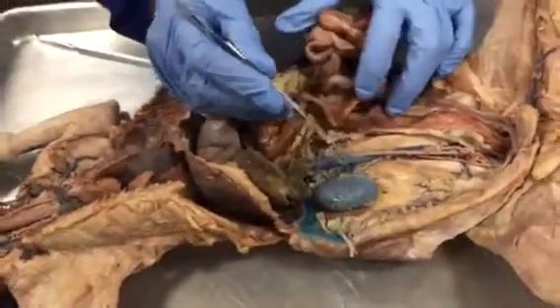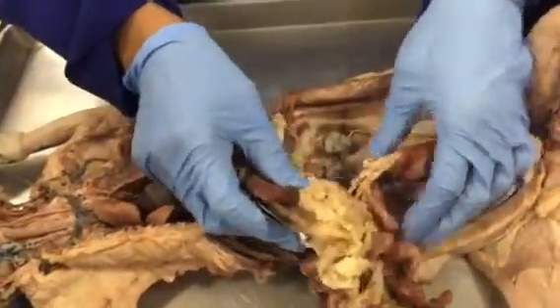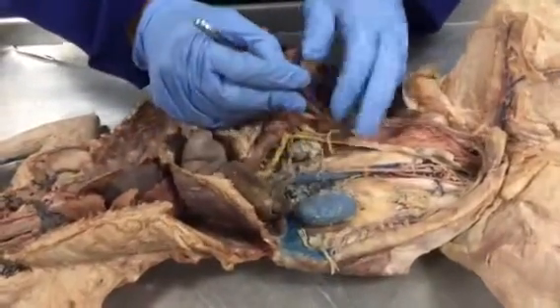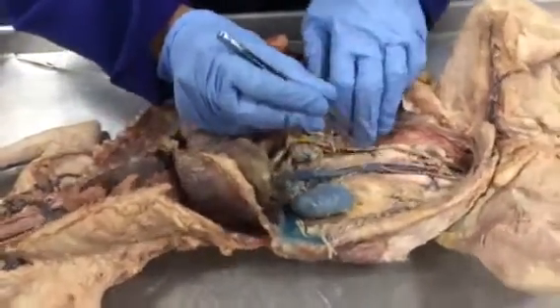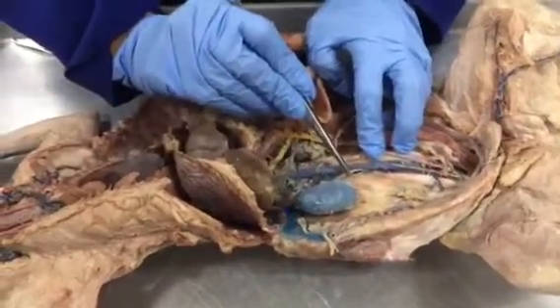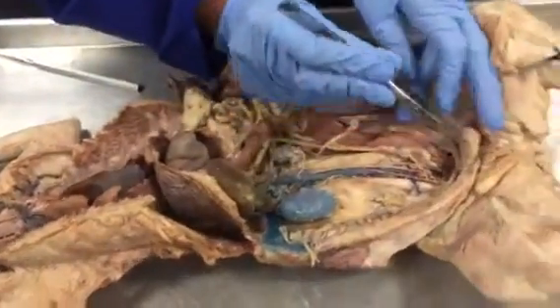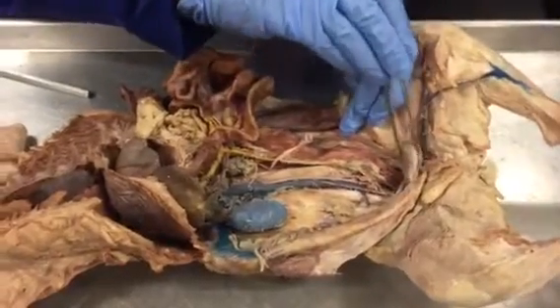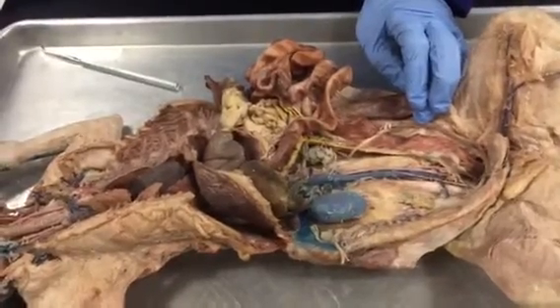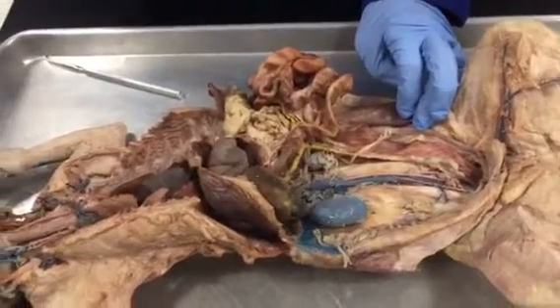So the ureter, here is the kidney, and the ureter is coming out from the kidney and going down. And then it will connect to the urinary bladder. So here, this is the ureter. The ureter is a tube-like structure which comes out from the kidneys, goes down and joins this one. Here is the urinary bladder, where both ureters will empty.